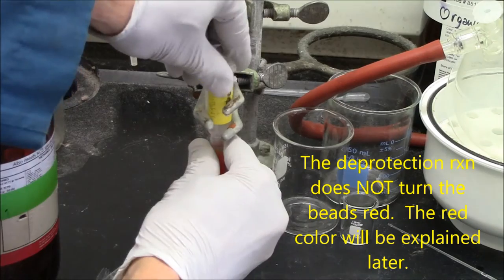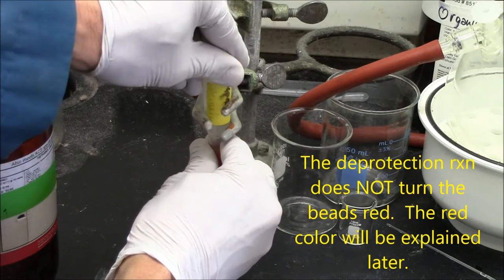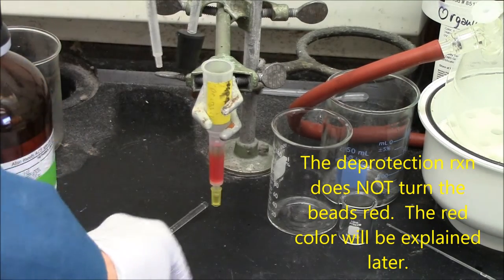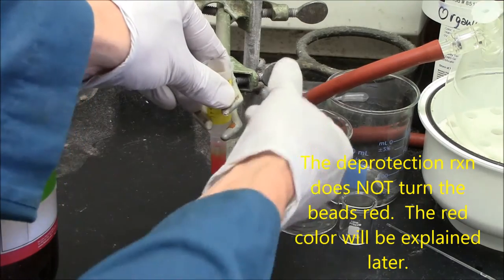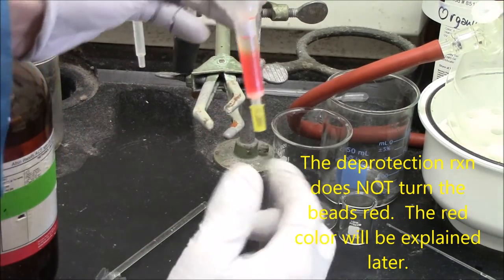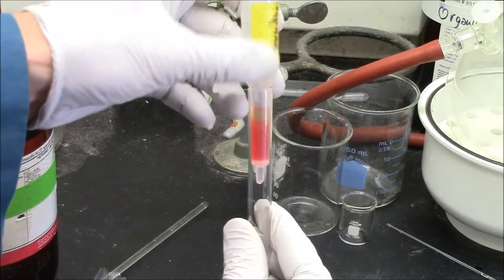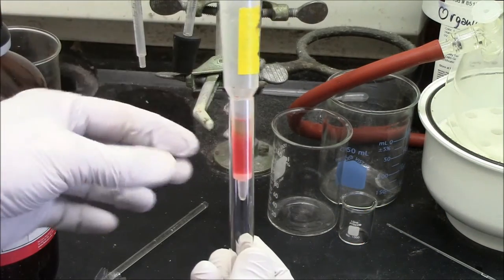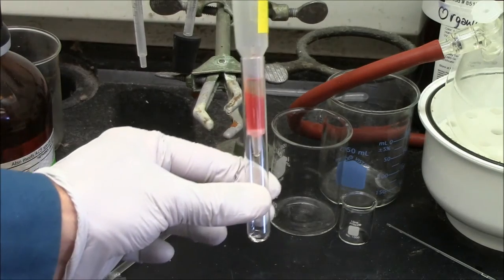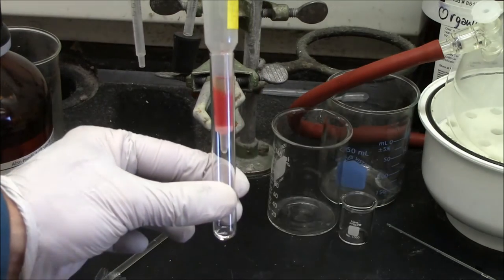Pressure can build up during the deprotection. It's important to open the top first to release the pressure before opening the bottom. Now I can open the bottom and collect the deprotection solution without pressure forcing the liquid out.